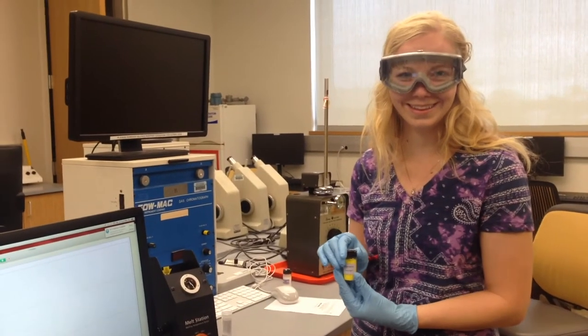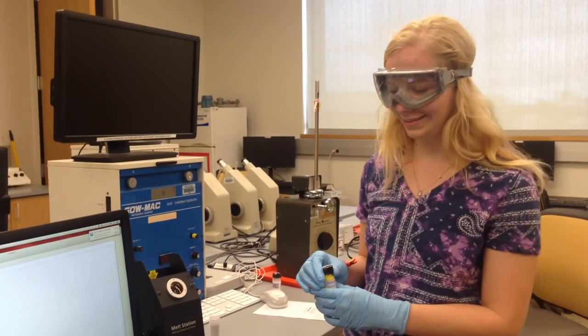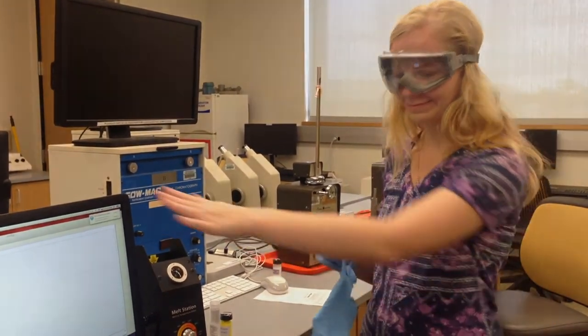As usual when in lab, all the normal safety gear is required. This means goggles, close-toed shoes, and gloves. But take your gloves off before you touch the computers.